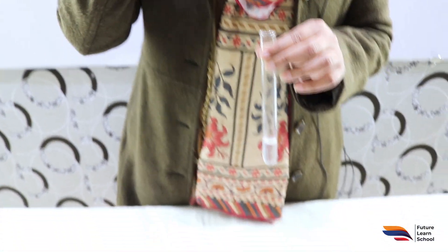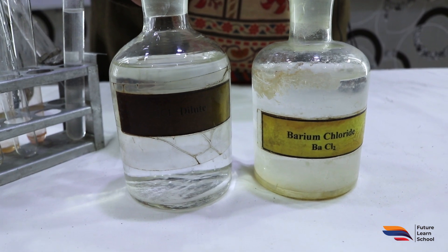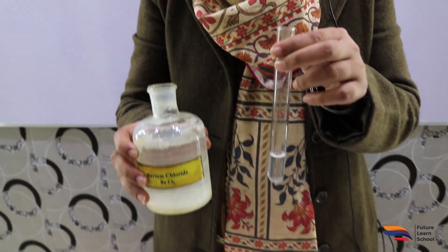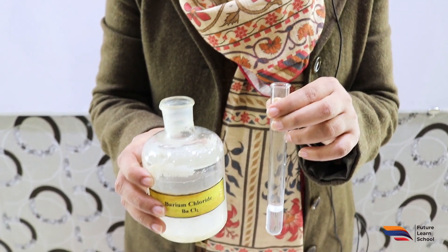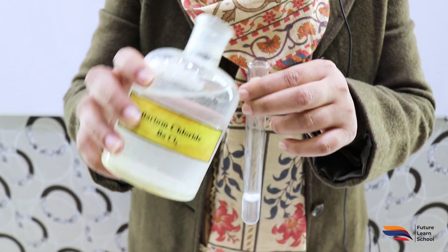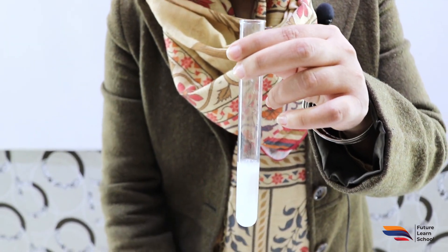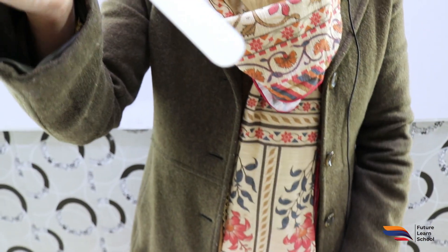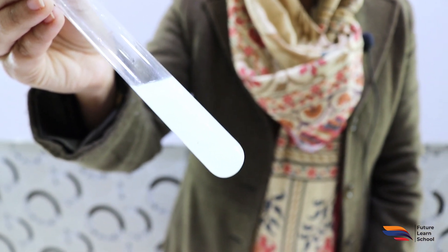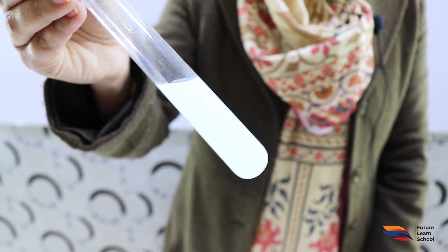The reagent required is barium chloride solution, which should be diluted. We add a small portion of this reagent to our original solution. Here we can clearly see that precipitate formation has occurred in the test tube. This confirms the acidic radical is in Group 1. Group 1 radicals are chromate, sulfate, sulfite, and carbonate.